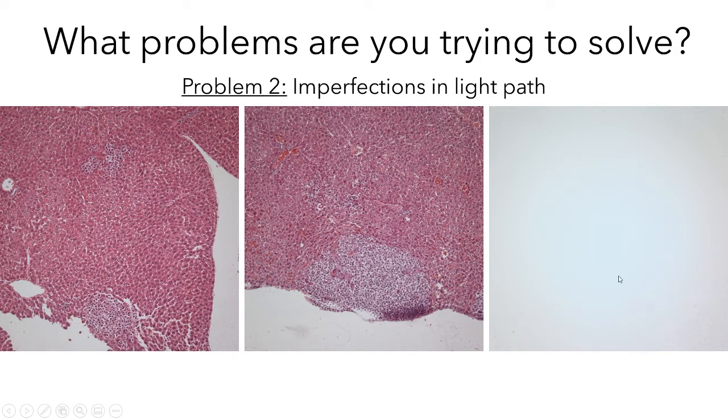And you can also see that the center of this image is significantly brighter than the edges. Not as much as the other image, because the other image was taken on a different microscope where, if you take it with the conditions that that image was taken with, that problem is particularly severe. Okay, so those are the problems that you're trying to solve.